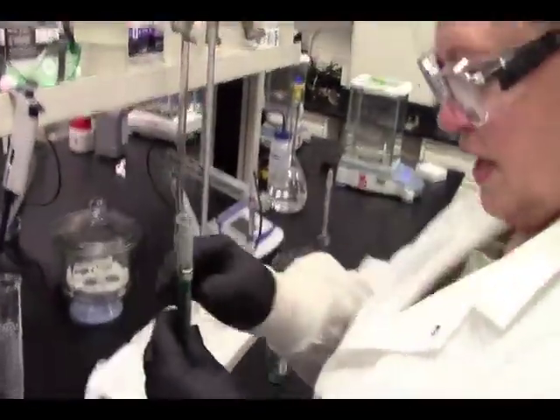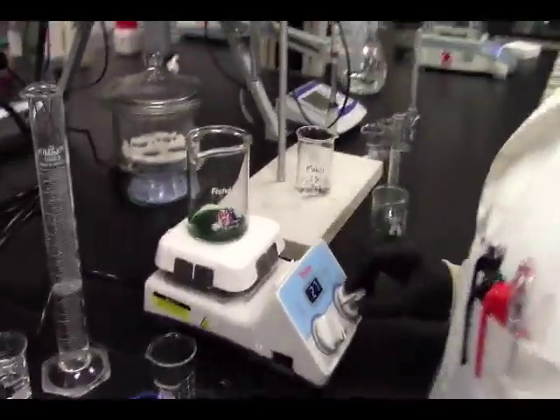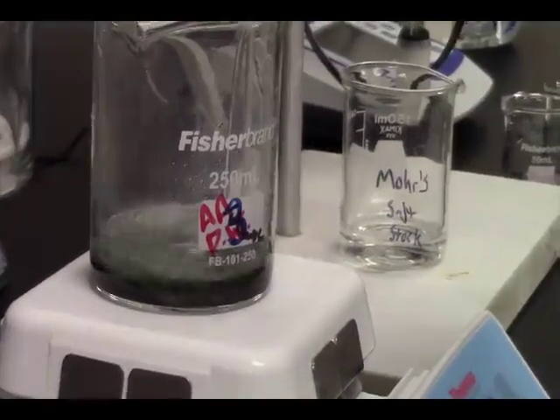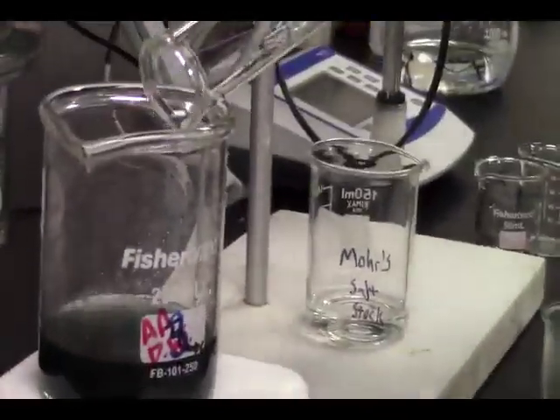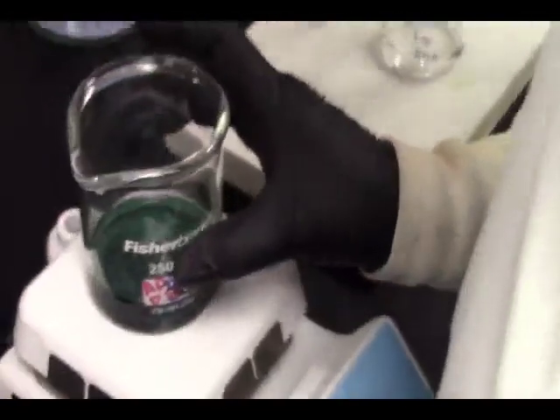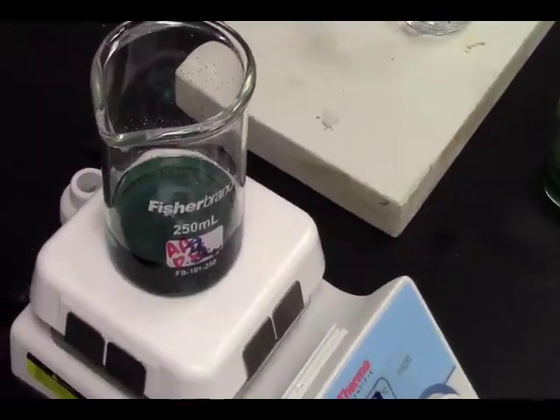We're going to take 10 milliliters of that. Put it in a different beaker. And to this, with stirring, we're going to add our 40 milliliters of nitric acid. And we got the same color. Well, almost. That's more teal. That's more teal. This is more blue-green. Say it's darker. Blue-green, it is darker, isn't it?